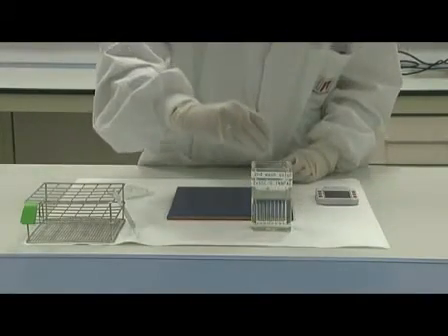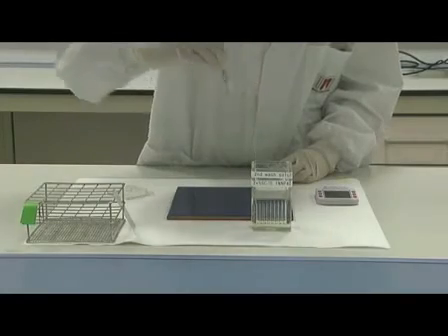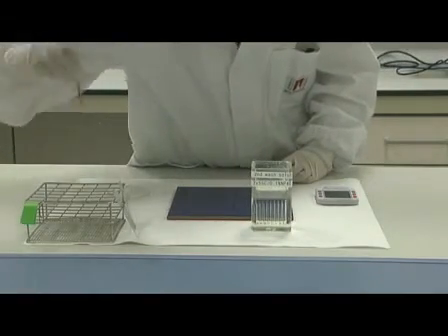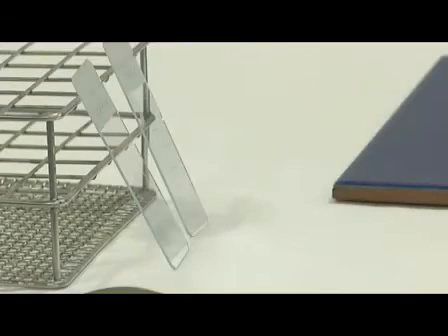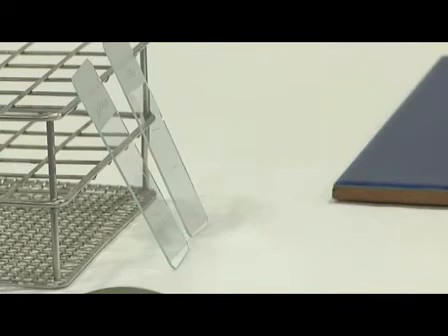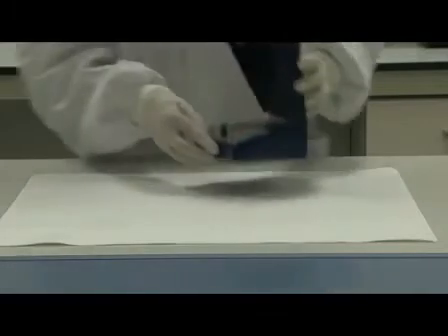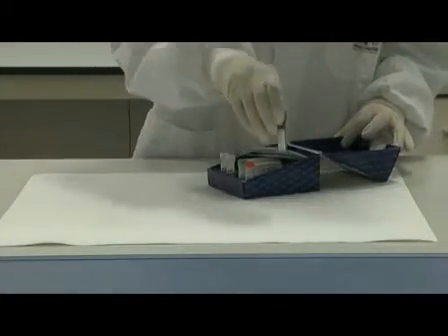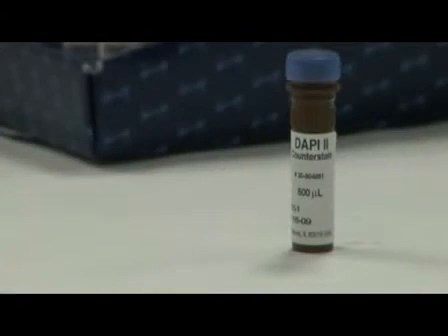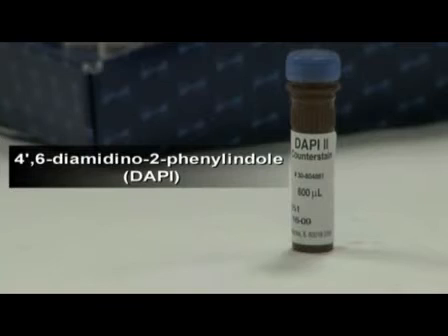After these two washes, we have to wait for the slides to dry out to conclude the last step of the protocol. At this point, a counter-staining product is added to facilitate the visualization of the nucleus of the cells. One of the most common products used for this purpose is DAPI.